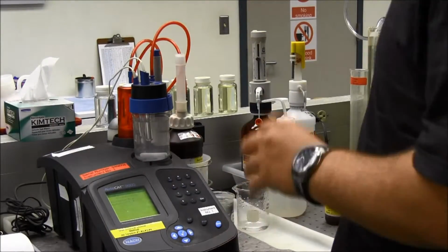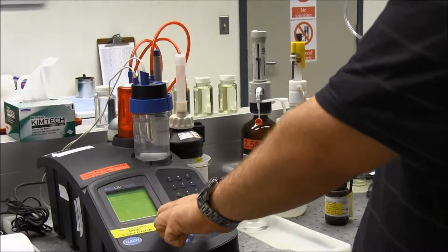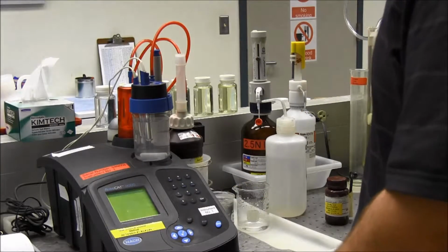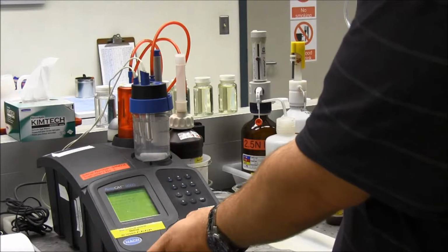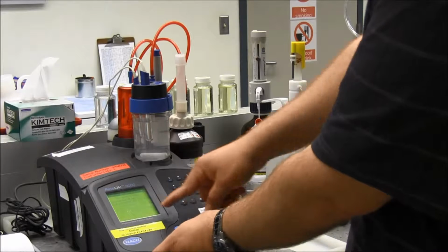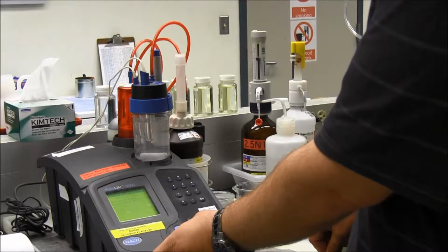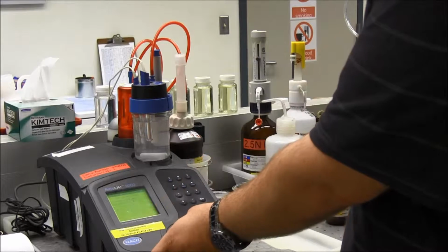Right, so this is the end of my third titration. It's making my noise again. So I have another nice long line with a nice endpoint. So I'm going to adjust the cursors again. I'll hit delete. I'll go in and I'll adjust my fourth cursor first. I'll bring that one all the way up to the end once again. My third cursor goes just past the end point. Second cursor just goes just before the end point.